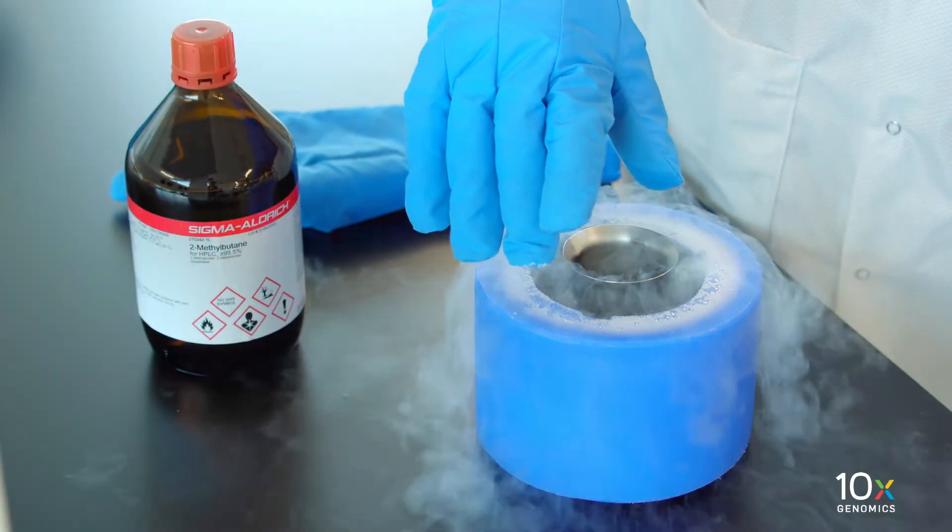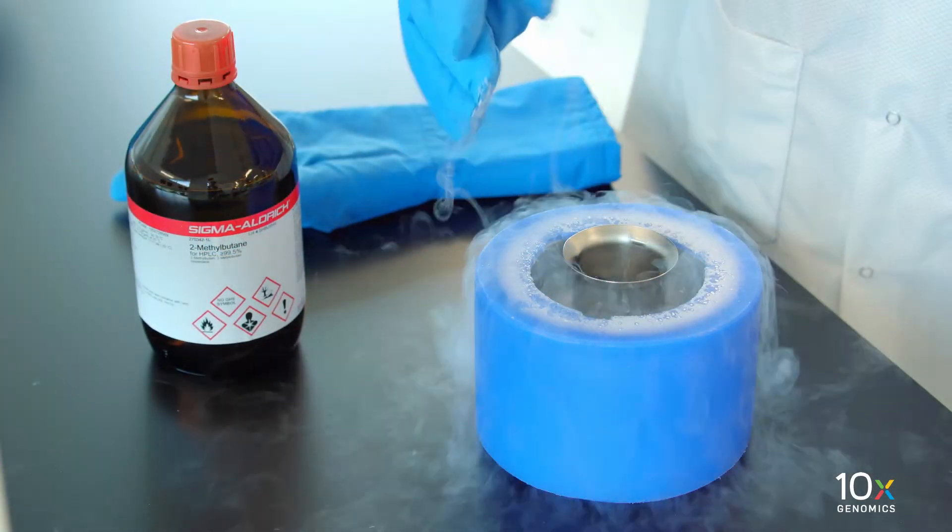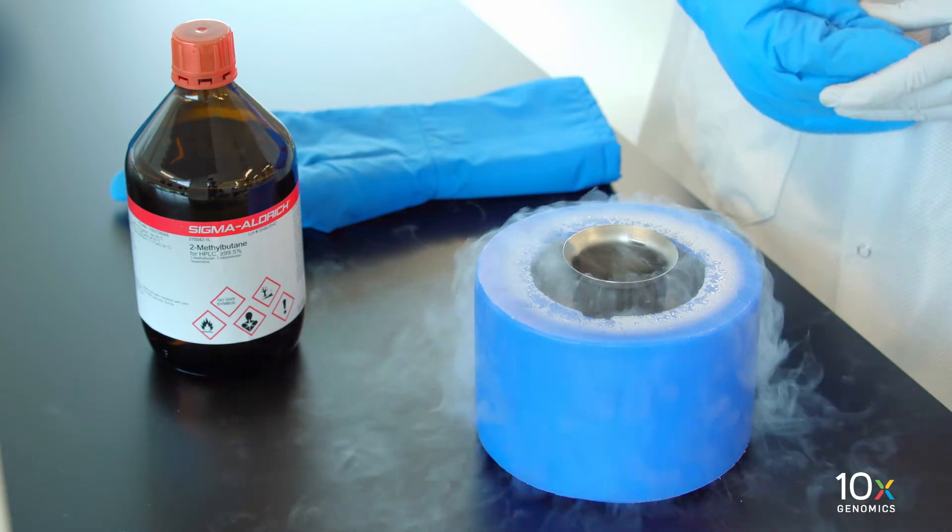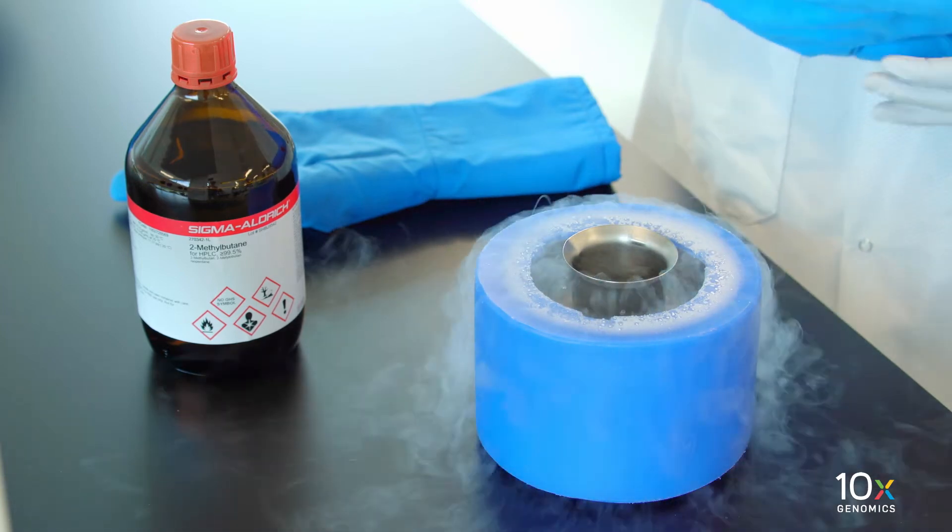Place in a dewar of liquid nitrogen filled to the same level as isopentane to allow sufficient contact. Incubate for at least 15 minutes.